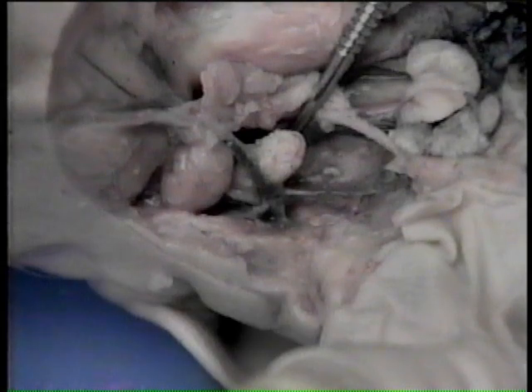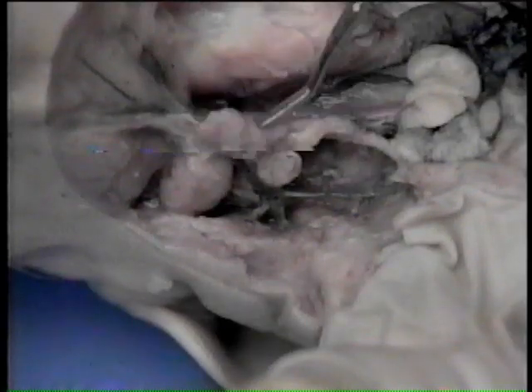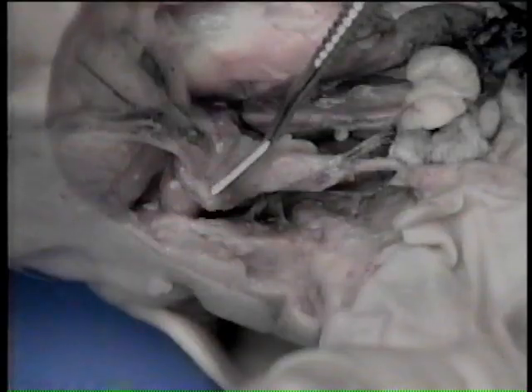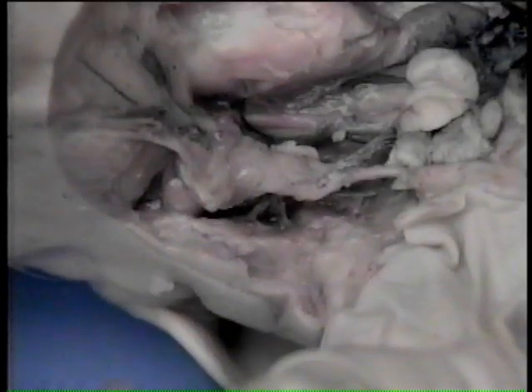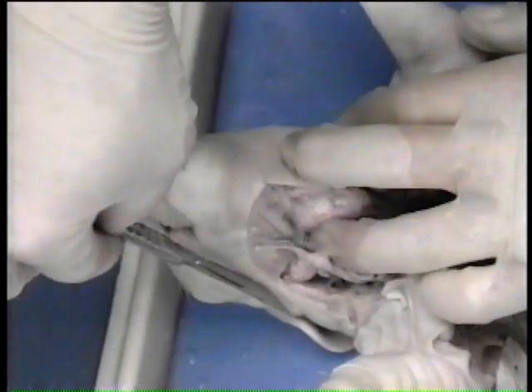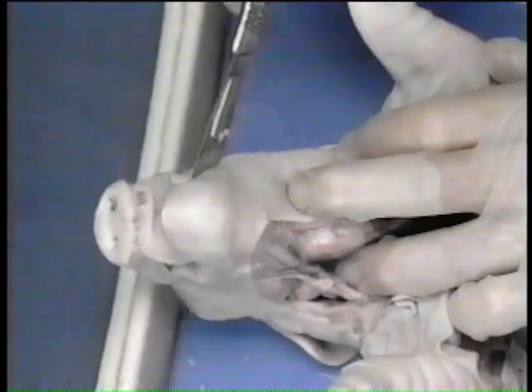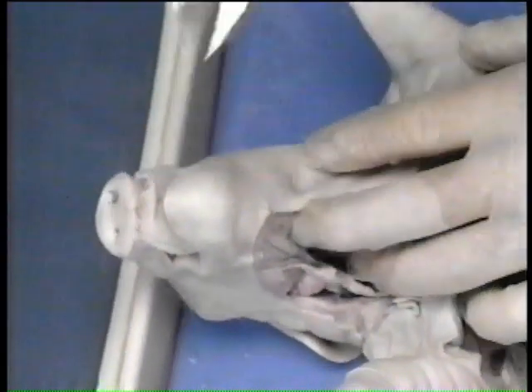The secretions from these salivary glands maintain the mucous membranes of the mouth and pharynx in a moist condition and lubricate food for ease in swallowing. The glands also produce enzymes that initiate carbohydrate digestion. With the scalpel and bone shears, cut back through the corners of the mouth. Continue the cut until the lower jaw can be dropped, allowing the interior of the mouth to be observed.